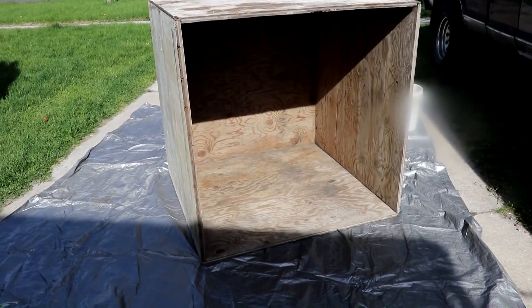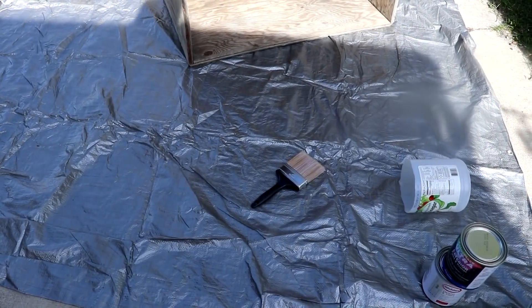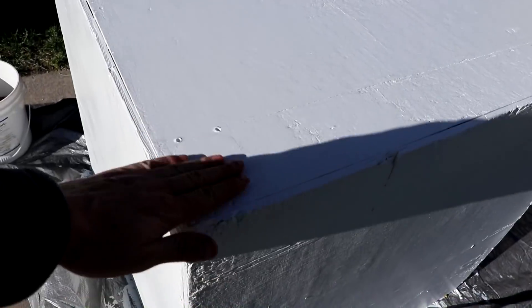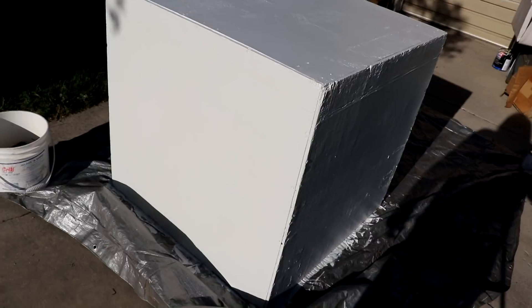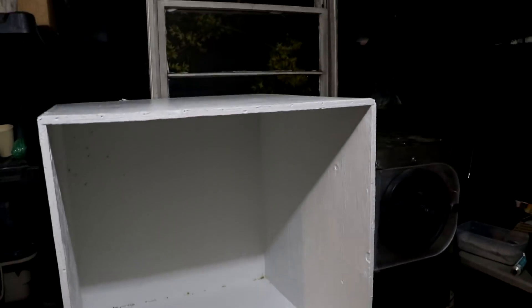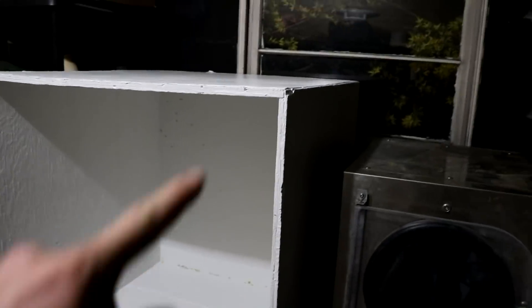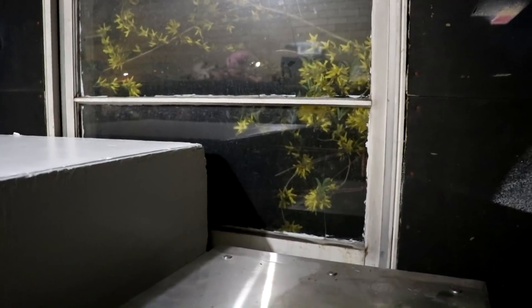The box is cleaned up, I've laid out a tarp and I've got some paint — let's brush it on. The box has been painted and has dried overnight, and I think it's time to put it in its place. There's the box in the location I'm planning on it being. There's still some work to do: I've got to put the door on and cut the hole in the back for the vent. You can see how I've got that lined up with the window — I can just slide the window open, put the vent on, and away we go.